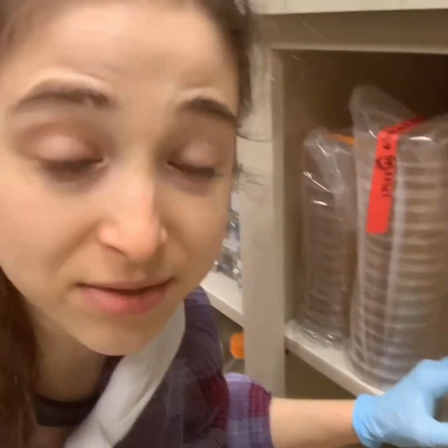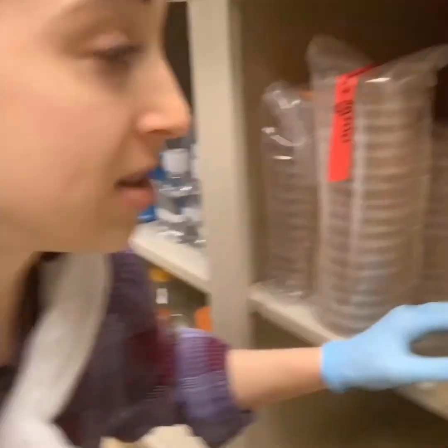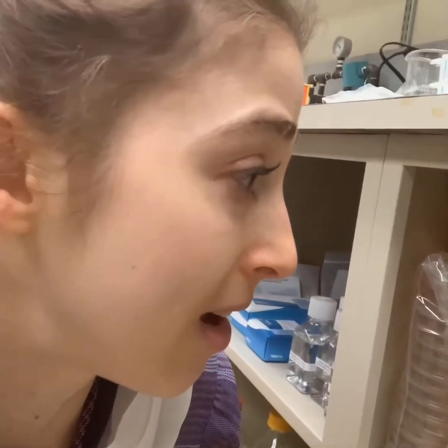Other plasmids have different antibiotic selection markers. We have a bunch of different plates for a bunch of different purposes, and today I want to tell you about a few of the main antibiotics we use, which are ampicillin, kanamycin, and tetracycline. I'll also talk about some of the other versions of those, how they work, how the resistance works, and why it's really useful in biochemistry.